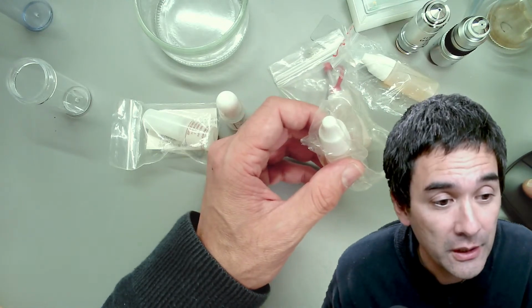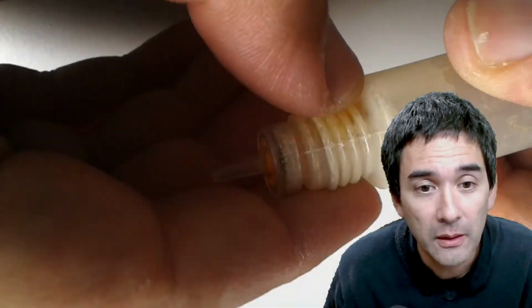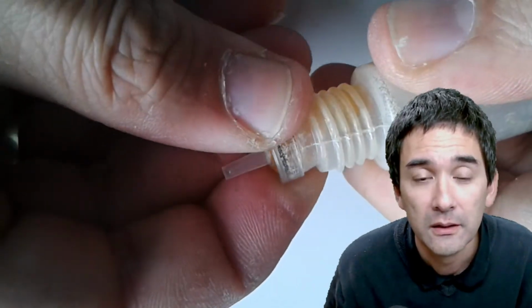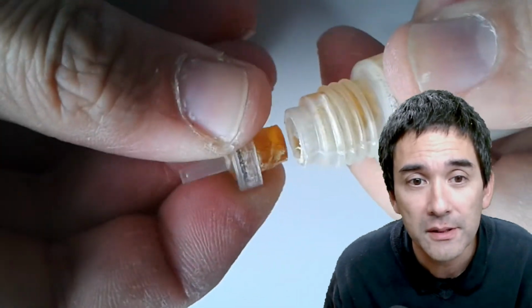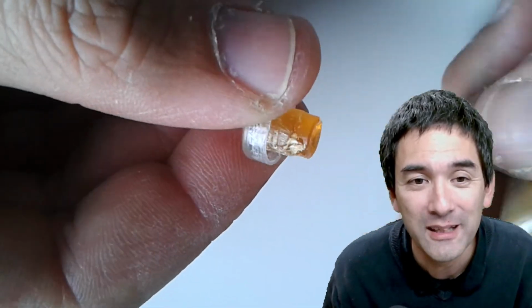I'm just going to show this to you. So I'm going to quickly show it to you. I'm opening a very old bottle, okay? And look what happens. You see this yellow thing here? Yeah, that is the solidified immersion oil.